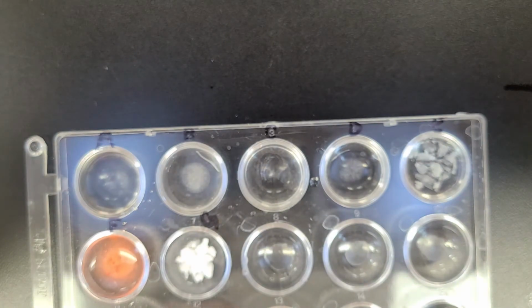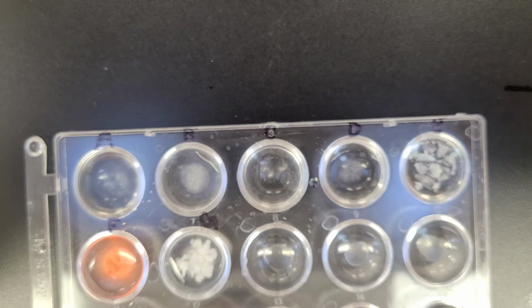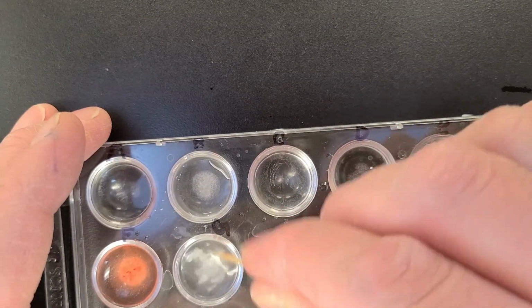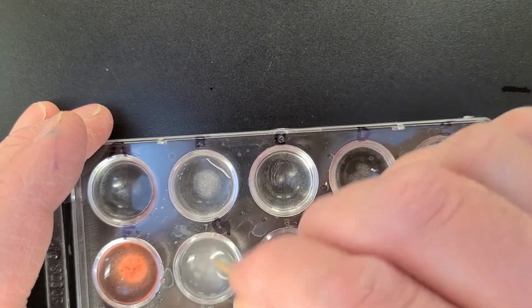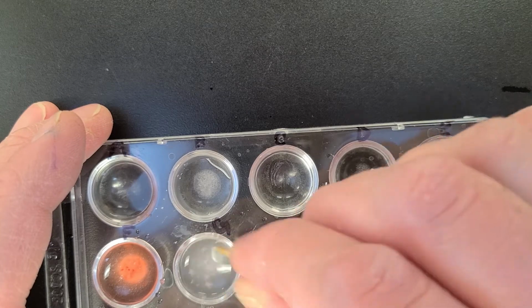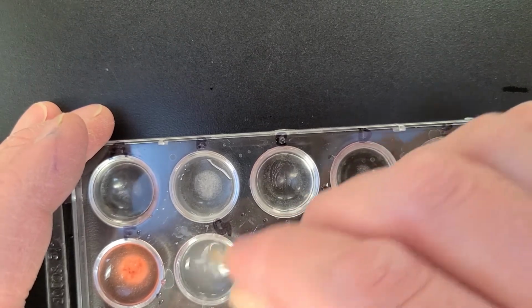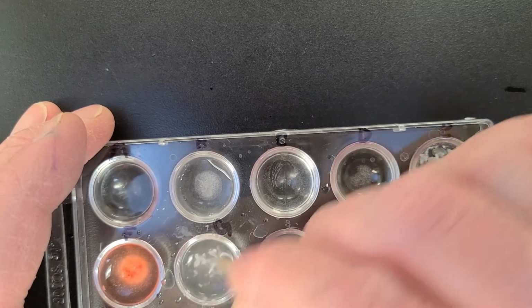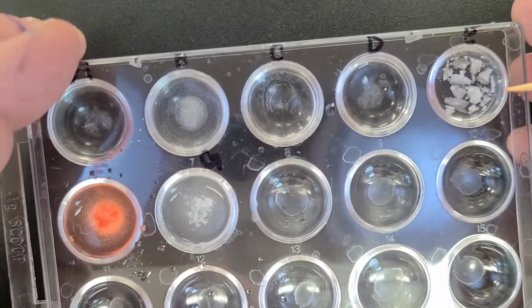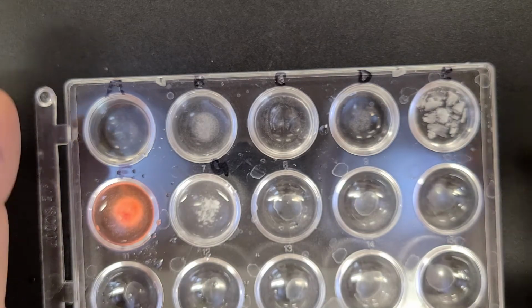And the last one, substance G. Give that one a mix. So compared to what there was originally, what is there now? All right, so we should be able to label that chart. And then the last thing we'll do is conductivity.